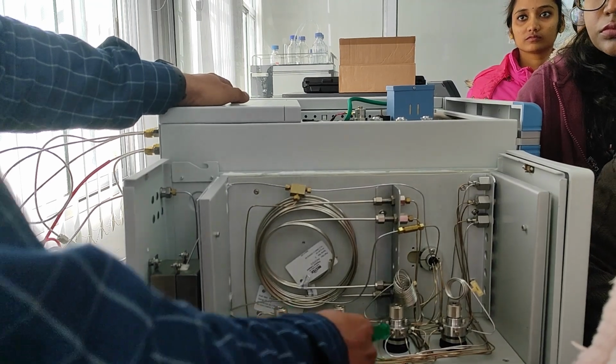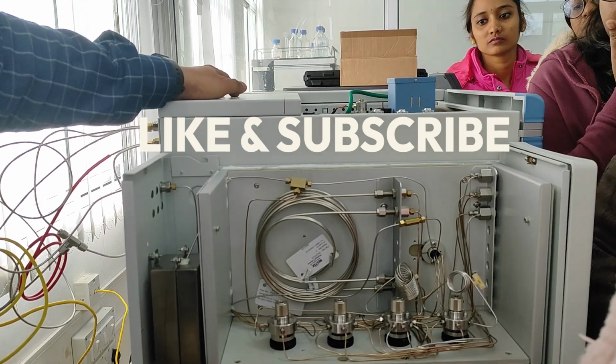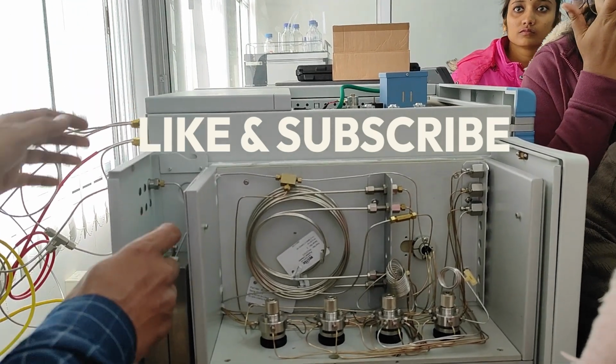All these valves cost beyond 2 lakhs. All are air actuated valves. This is the methanizer box.